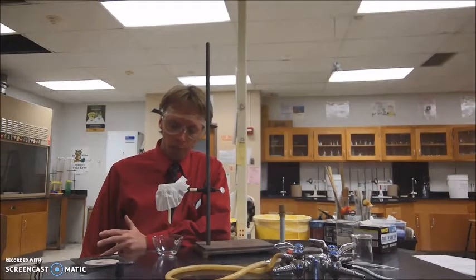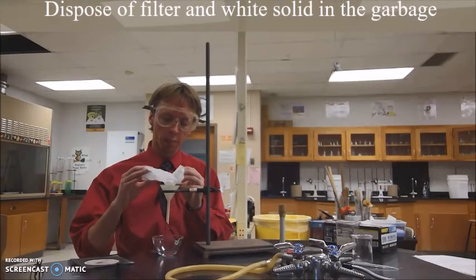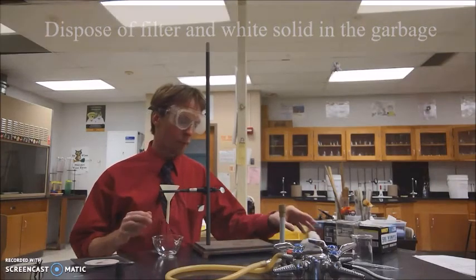My filtration is complete, and so I'm going to take my coffee filter with the white substance left over on it, and I can simply throw it away in the trash.